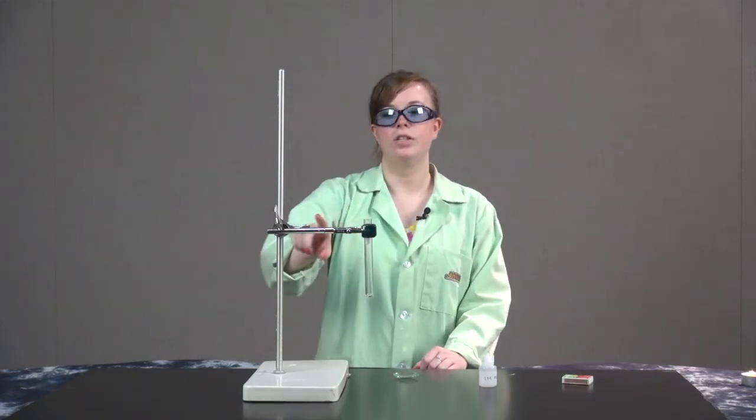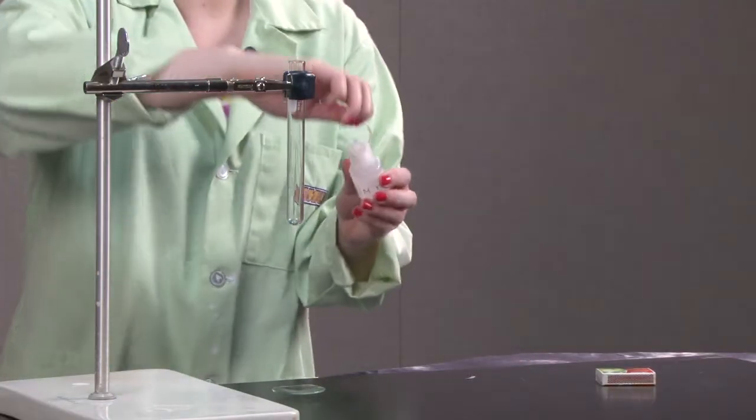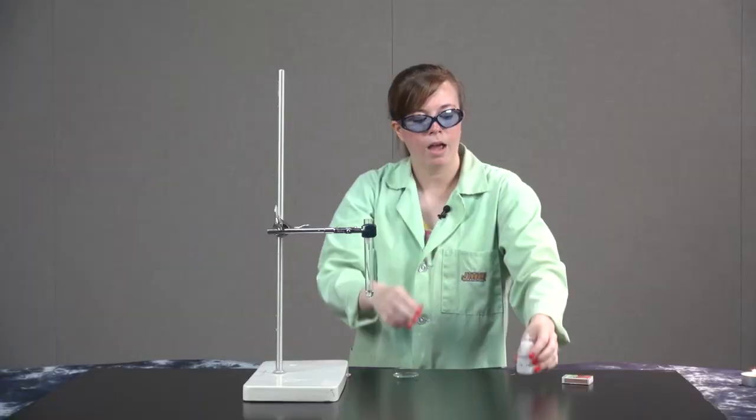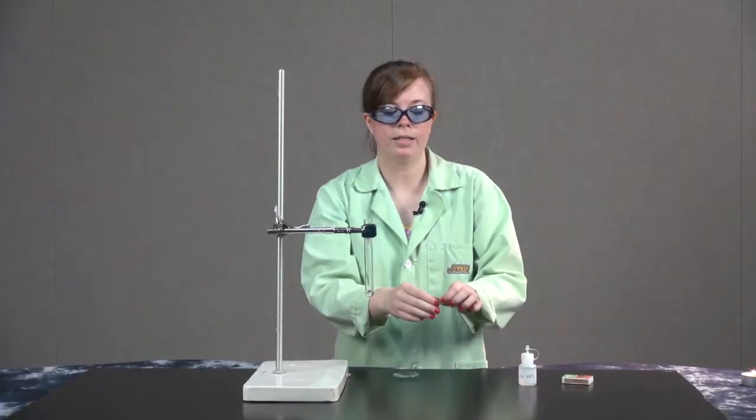Here I have a test tube clamped to a ring stand and to that test tube I'm going to add some 1 molar hydrochloric acid. I'm also going to add a piece of magnesium metal.